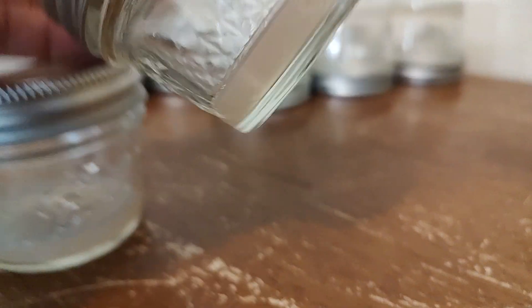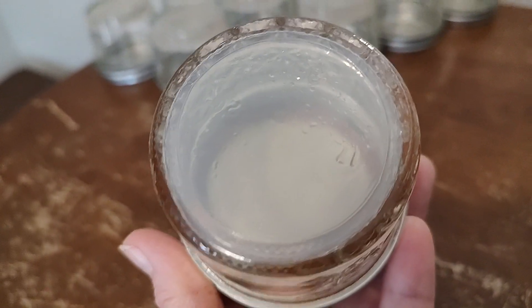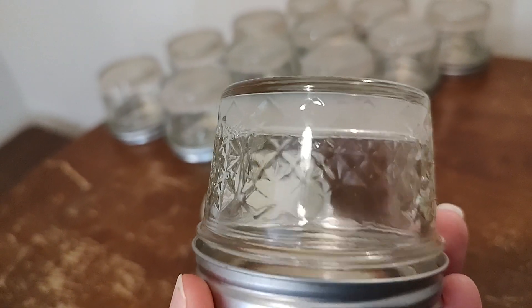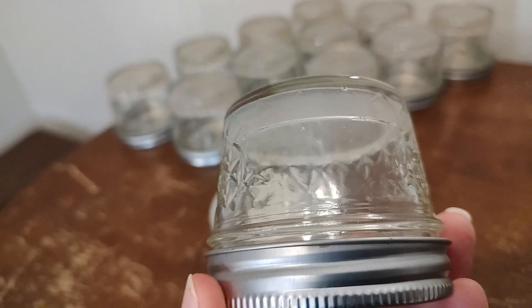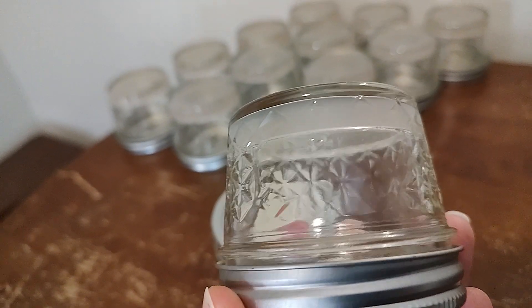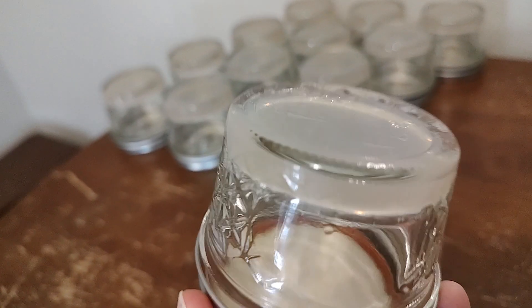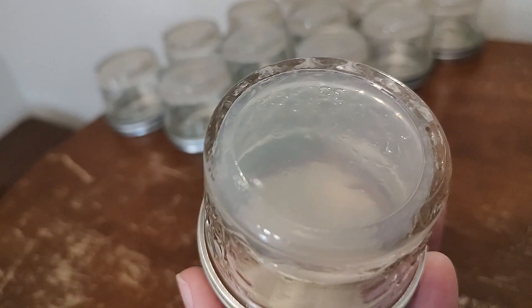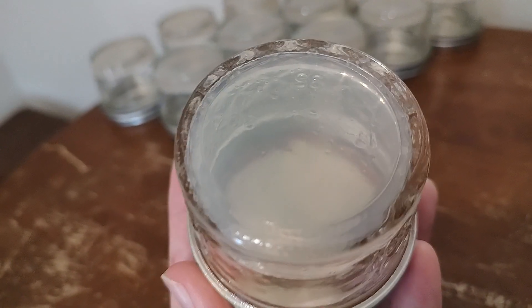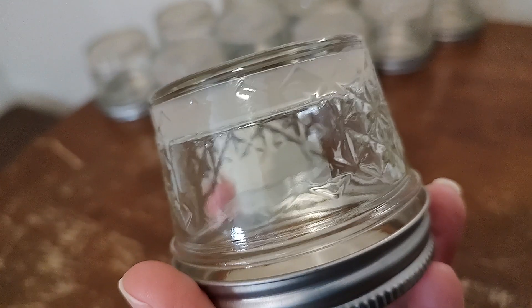So this is the very light MEA. We have shared in the past about water agar and eliminating contamination by using water agar — that works by robbing it of the nutrients and the sugar, the dextrose. He had this idea, because the water agar was so slow, to do an extremely light MEA, and that's what we have here.